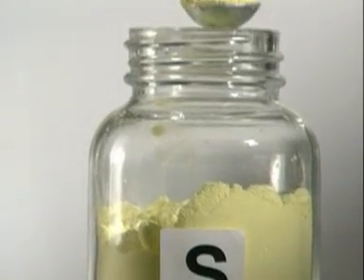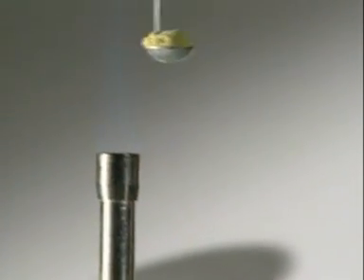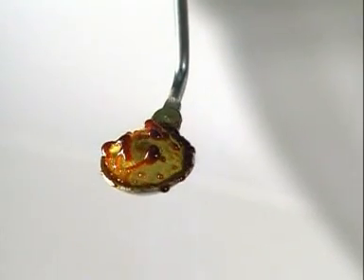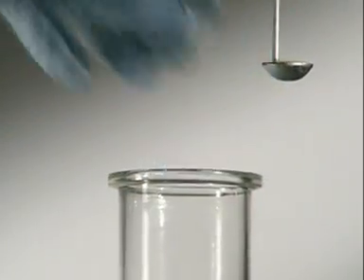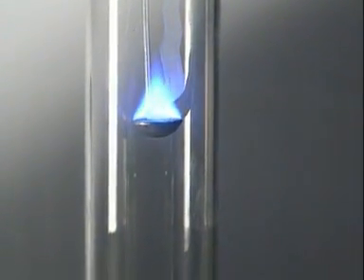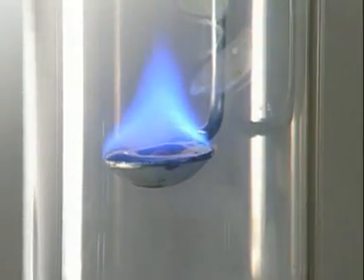Sulfur is a non-metallic element. When it's heated and plunged into oxygen, it burns with a characteristic blue flame and forms sulphur dioxide.